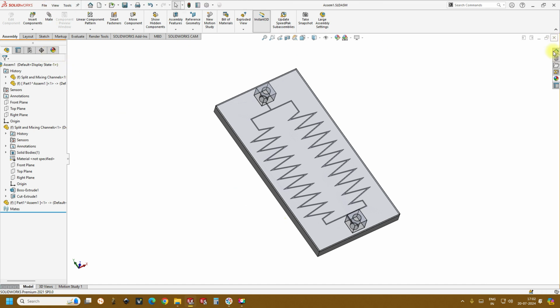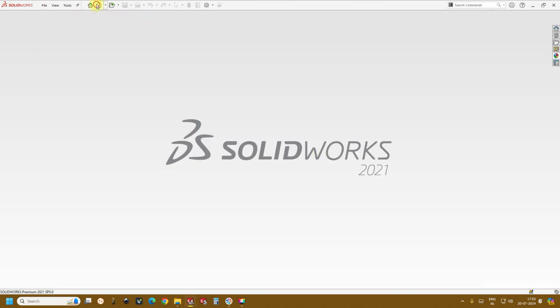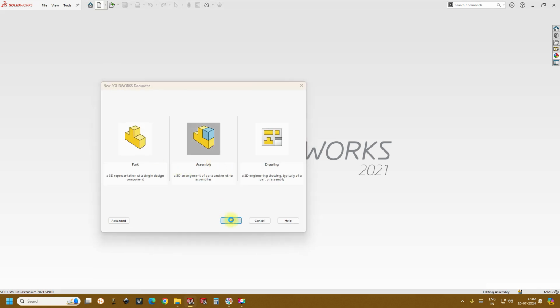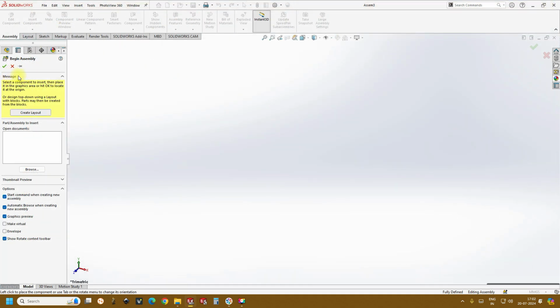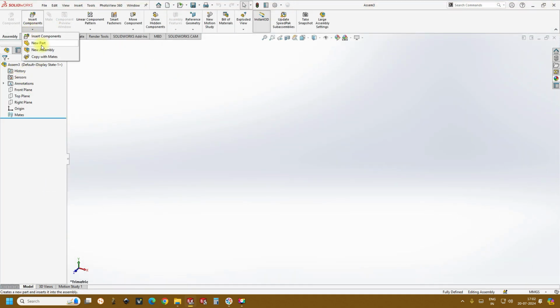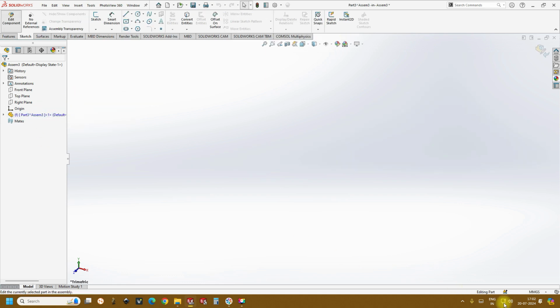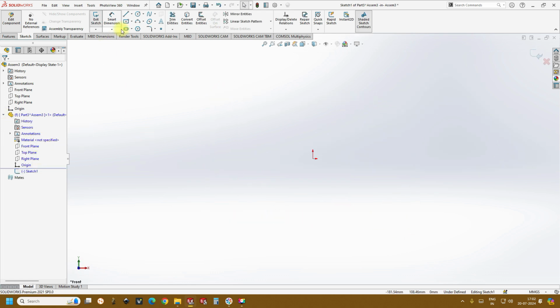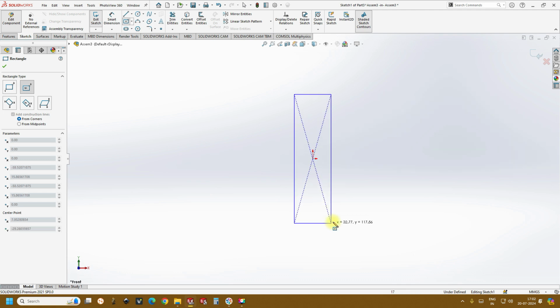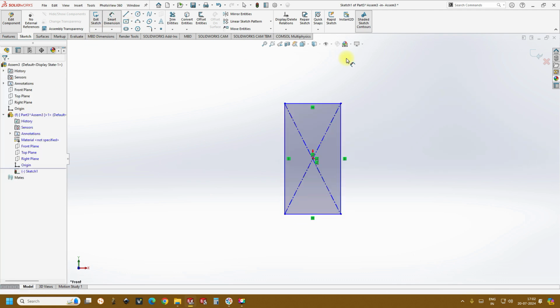Let's close this file and create a new assembly, followed by a new part, and just edit this like we did, and then select the front plane and create the rectangle like we do in the previous videos.